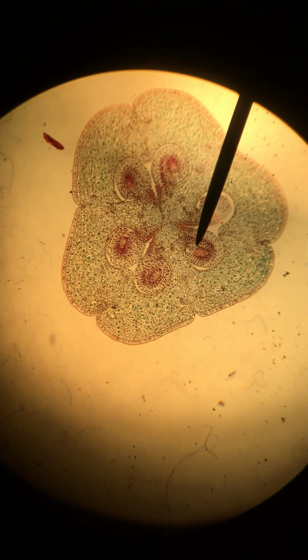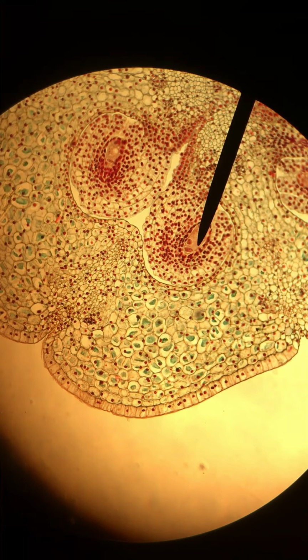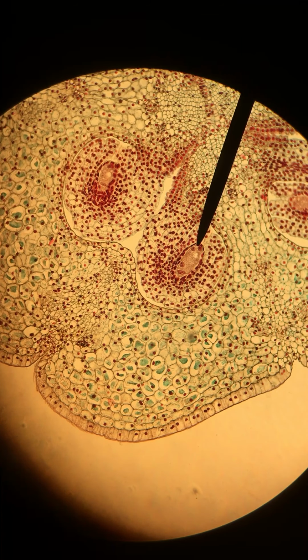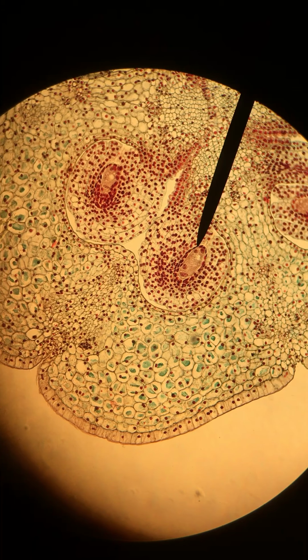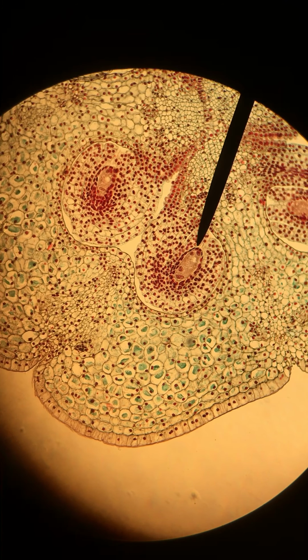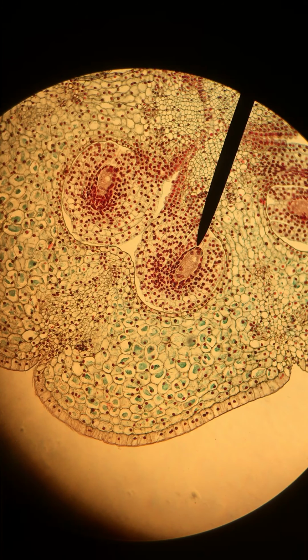Now that's about all we can see at this magnification, so I'm going to increase to about 100 times. We are looking at an ovule here, and now you can start to see that there are distinct bodies inside where we had previously seen the megasporocyte. As I mentioned in the last slide, the megasporocyte underwent meiosis, but only one of the 4 daughter cells from that meiotic event survived, and that was called the megaspore.